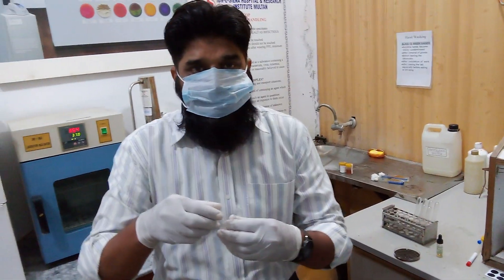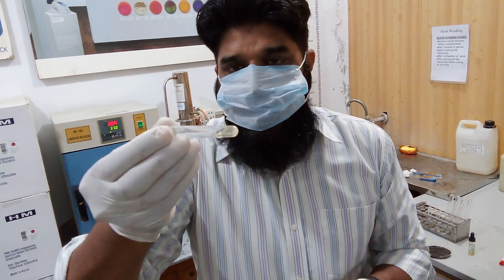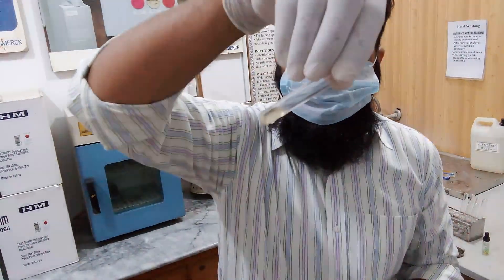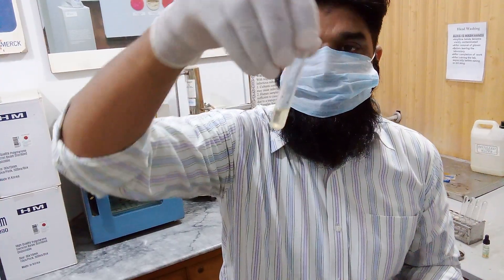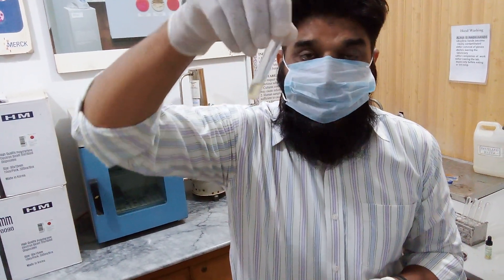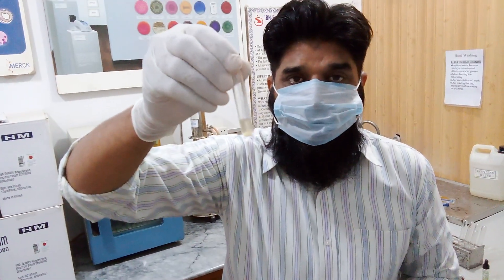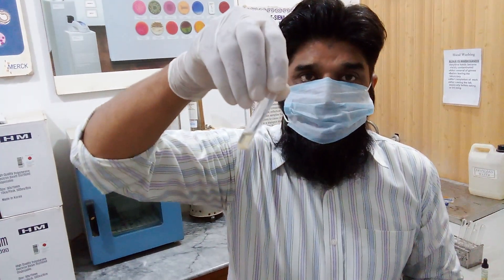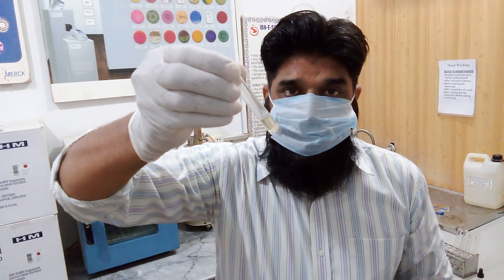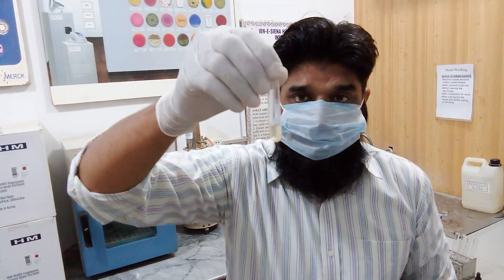Now we will see this type of result. You can see slanting of the liquid — this is the liquid surface and it is easily movable. It means the coagulase test is negative. There is no formation of fibrin, there is no clotting of plasma. This means coagulase test is negative.